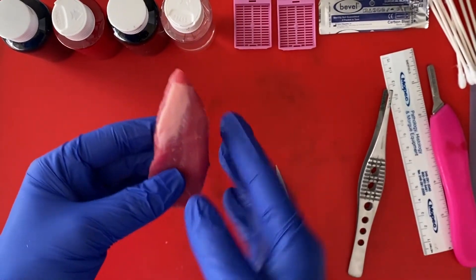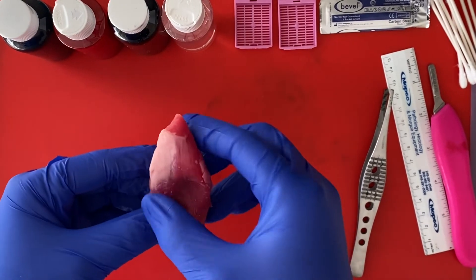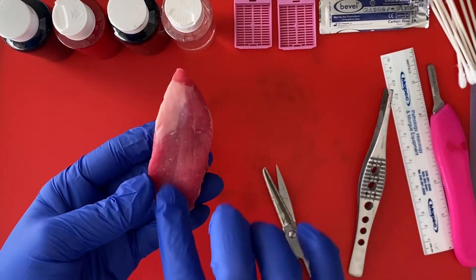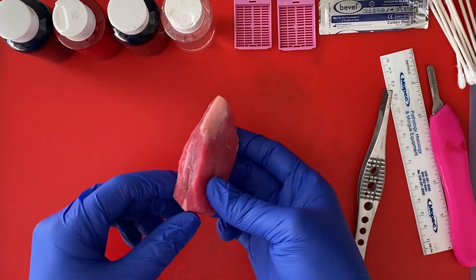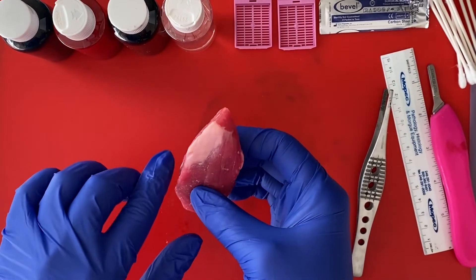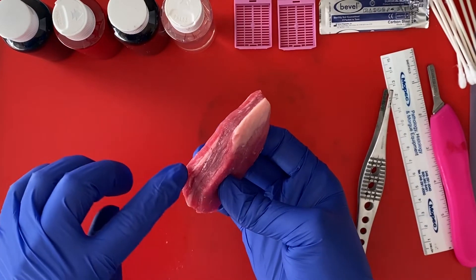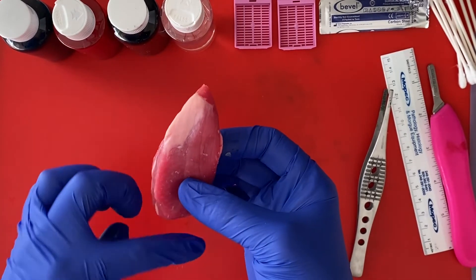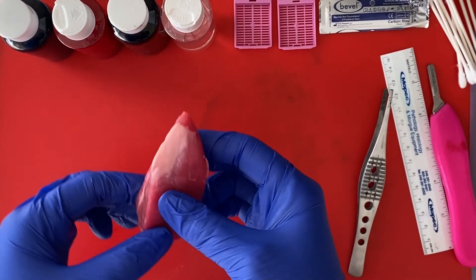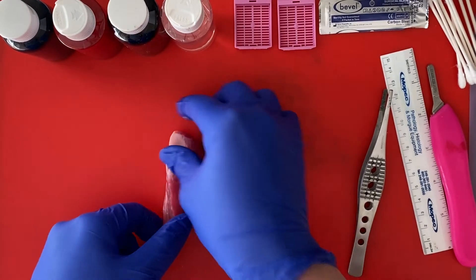This will be lateral, medial, anterior, posterior. In a human thyroid, we're going to be concave on the posterior aspect where we rest against the larynx. So our isthmus margin will be on the medial aspect towards the inferior — this is our isthmus margin right here. The rest of this is going to be thinly encapsulated with our thyroid capsule. So we have our orientation.